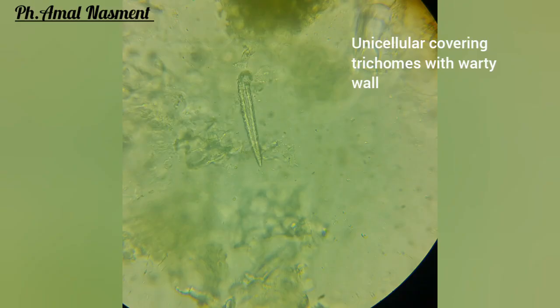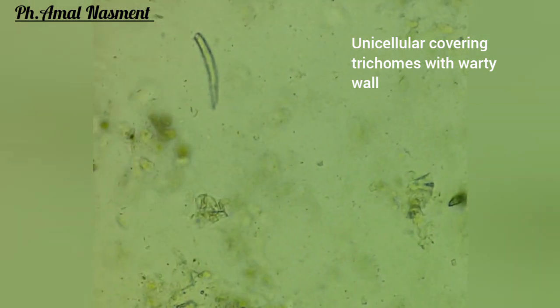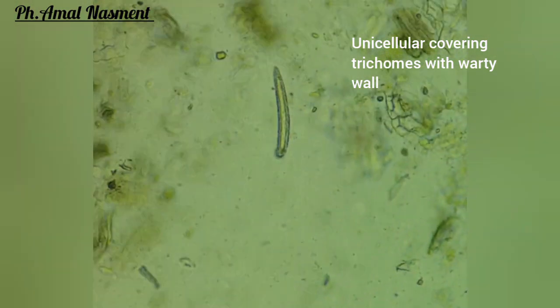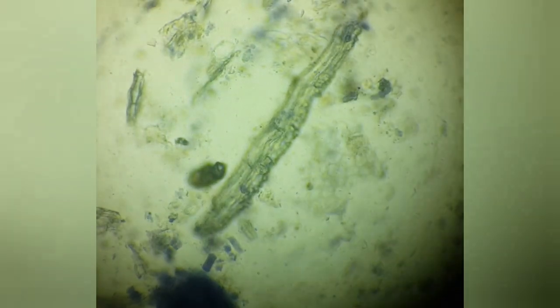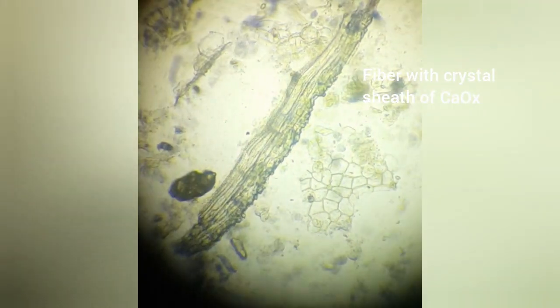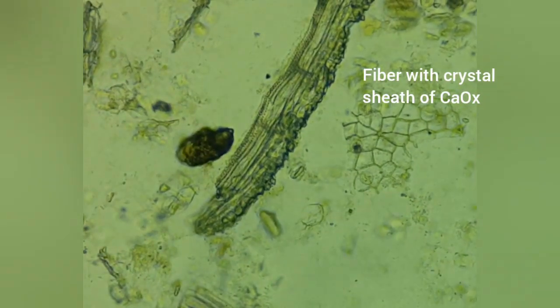a warty wall, and it is abundant in the senna leaf slide. The second key element is fiber. Fiber in senna leaf has a special calcium oxalate crystal sheath, as we can notice here.